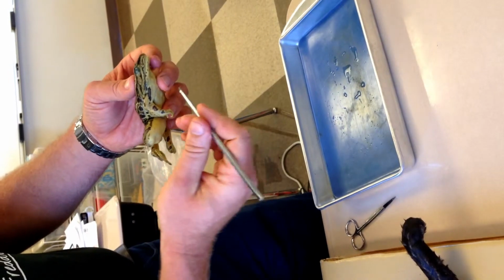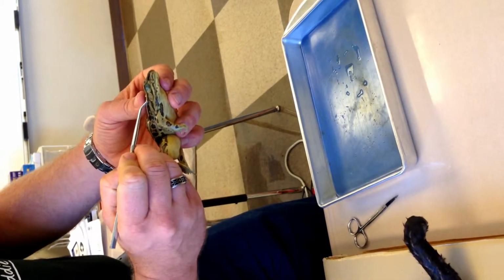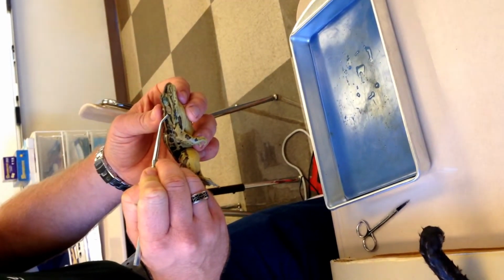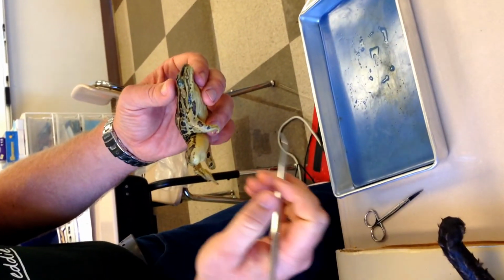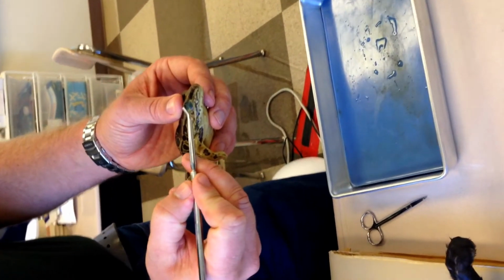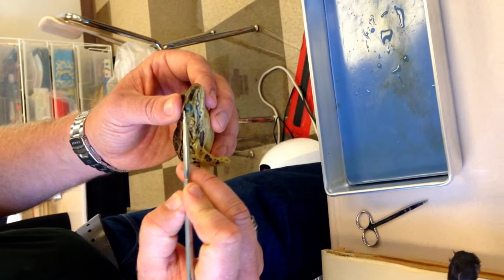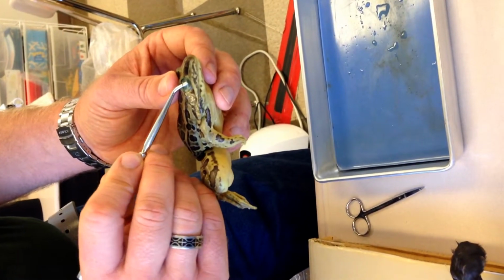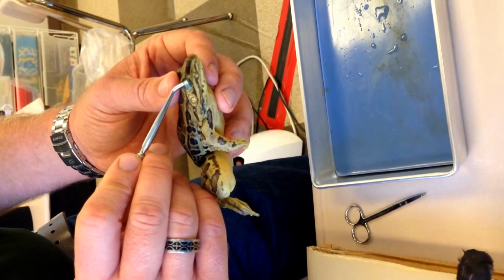Or this is obviously frog. Number one, the organ right here that it uses to hear. Number two, the eye, there's an upper eyelid, and then there's this clear membrane that protects the eye when it's swimming. Number two is this membrane.